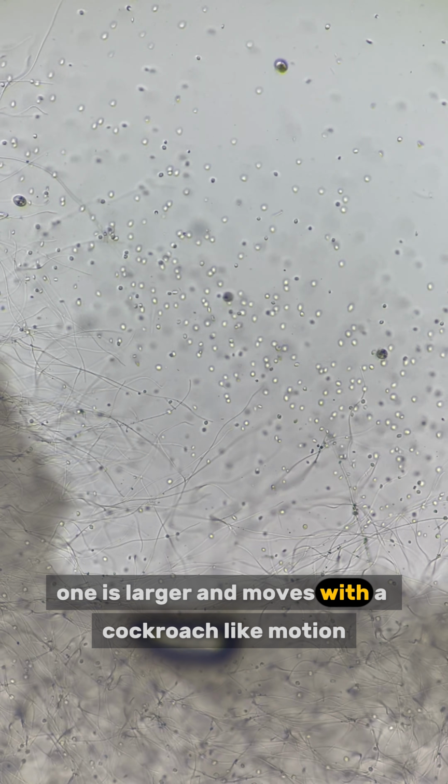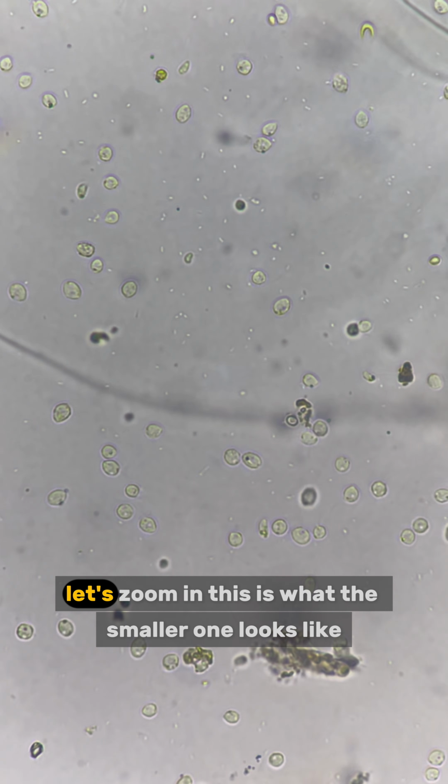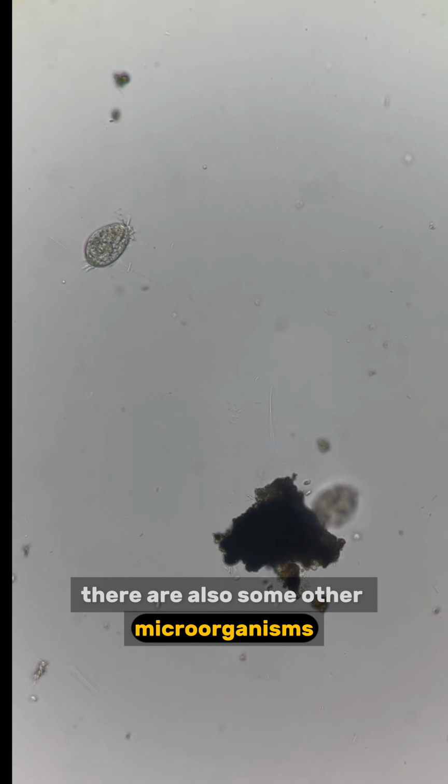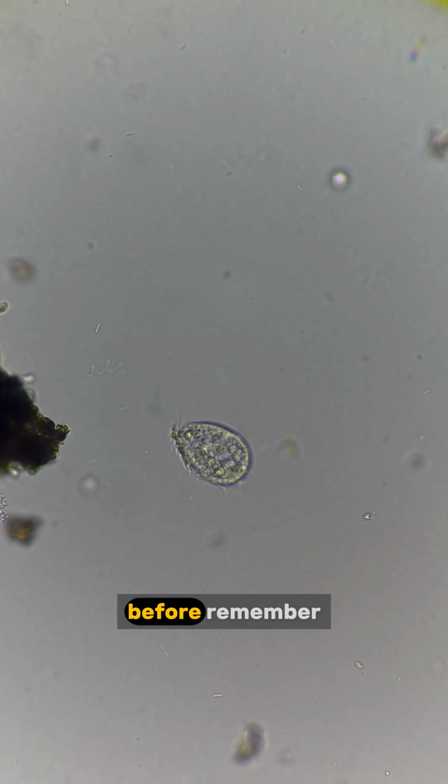One is larger and moves with a cockroach-like motion. The other is smaller and slowly flows around. Let's zoom in. This is what the smaller one looks like. There are also some other microorganisms that look like they have arms and legs moving around. I think this might be the same type that burst in front of us before.